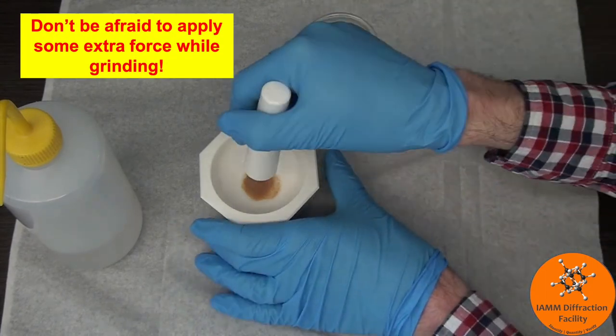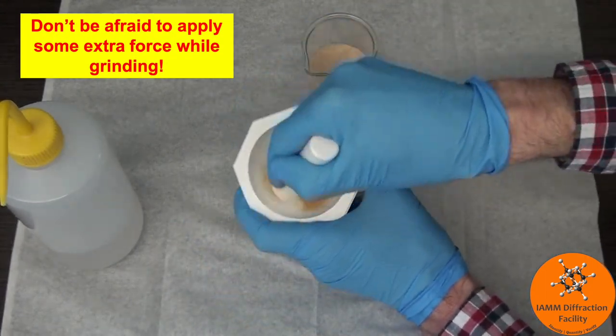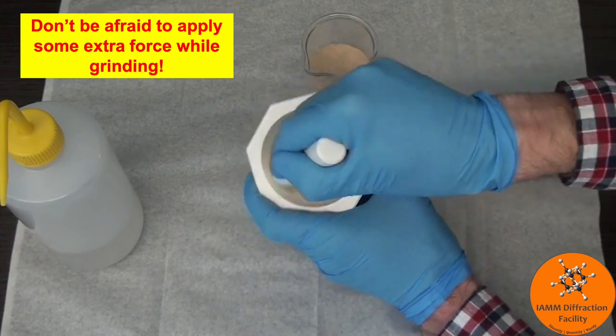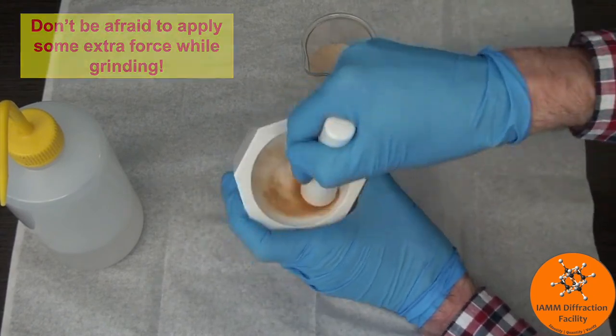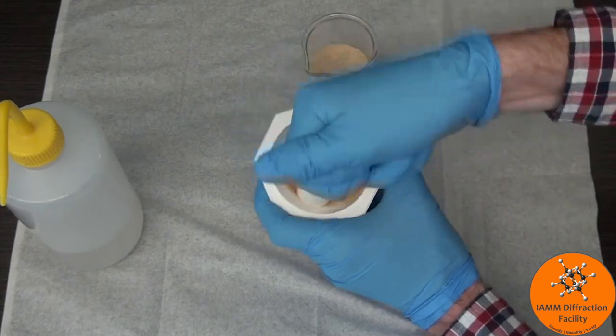And then grind it like you would a sample. This one has some dirty marks on the side, so I'm going to tilt it a little bit extra and really try to grind it there.